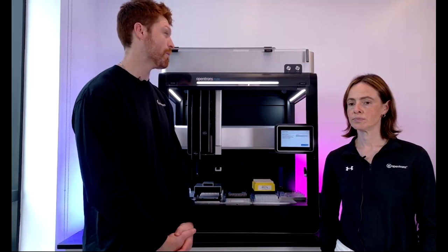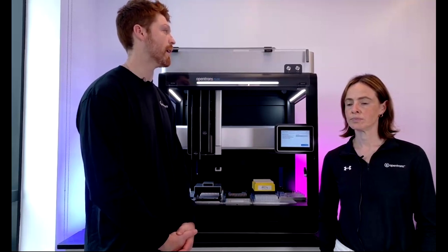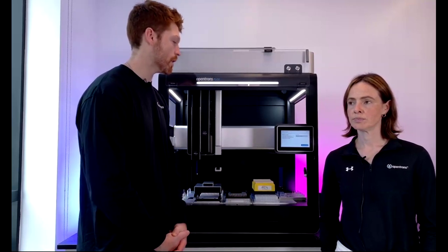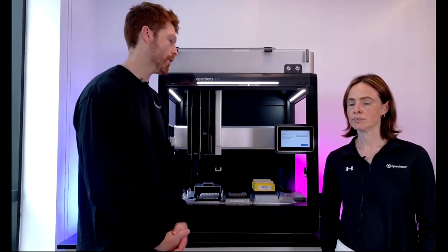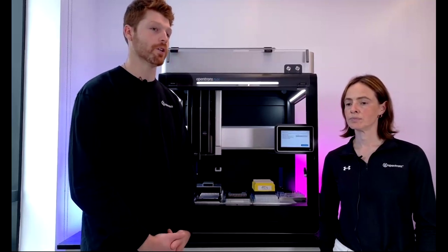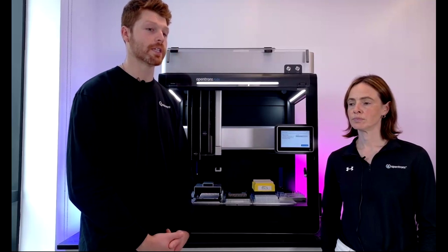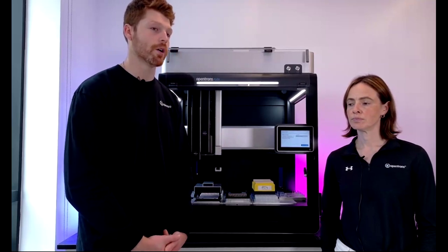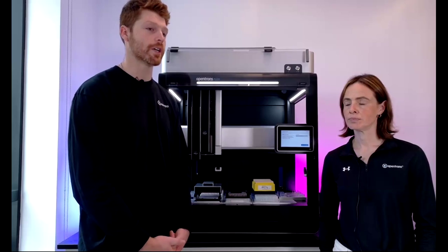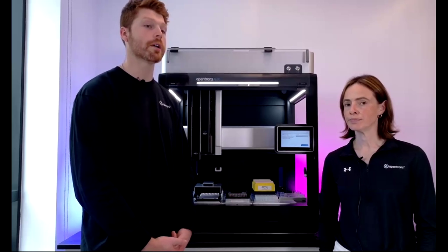It is 0.3 microns, so we do want to specify that it's not safe for viral work, and it's not a laminar flow hood. It is not taking anything up out of there, but it's really ensuring that the samples within the space are kept as clean as possible. So it's good for things such as bacterial and cell culture work.